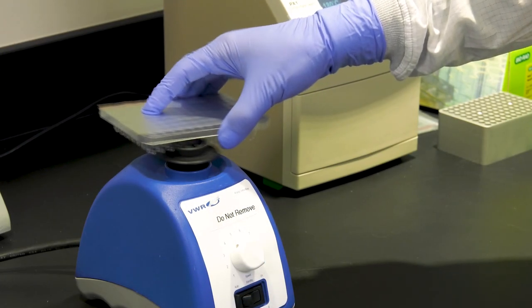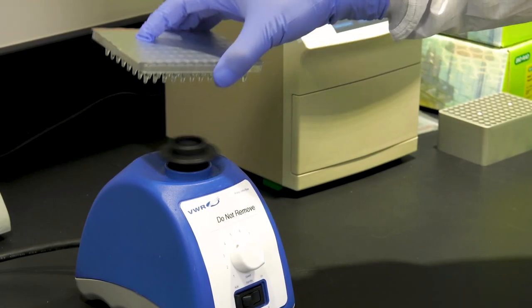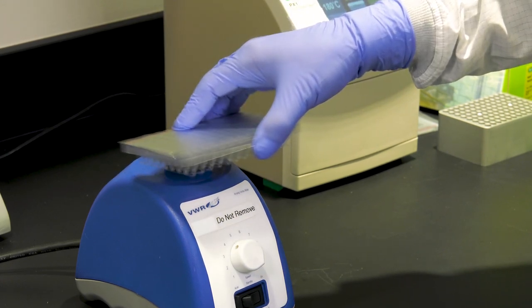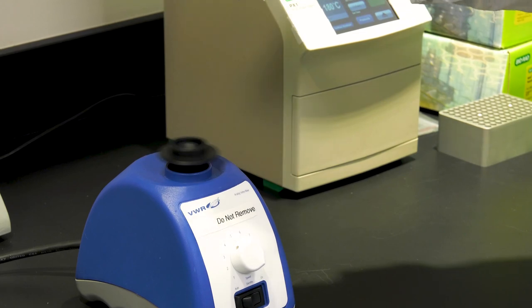Next, mix in two spots in the middle, the bottom middle part and the upper middle part, again for 5 seconds each. This will ensure that your samples are thoroughly mixed and generate good droplets.